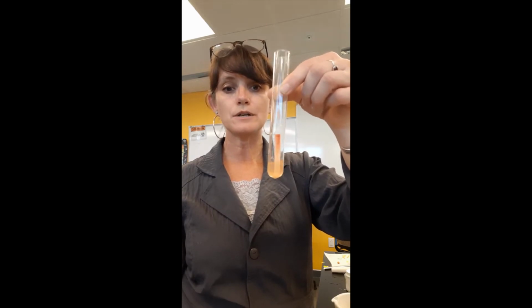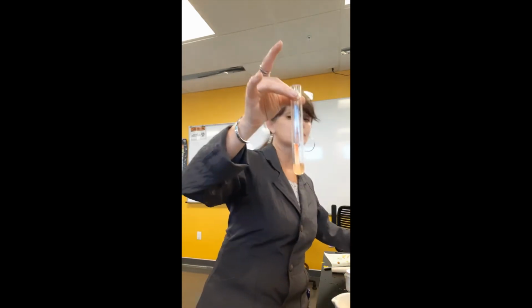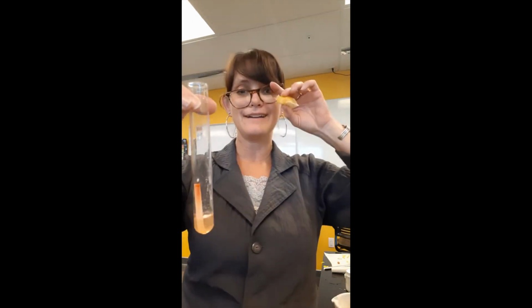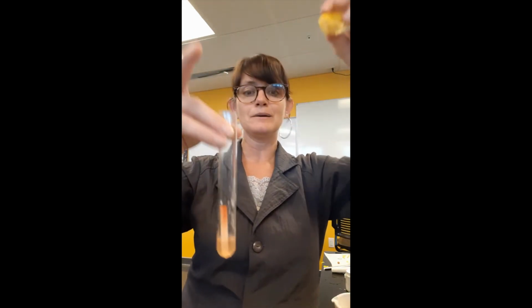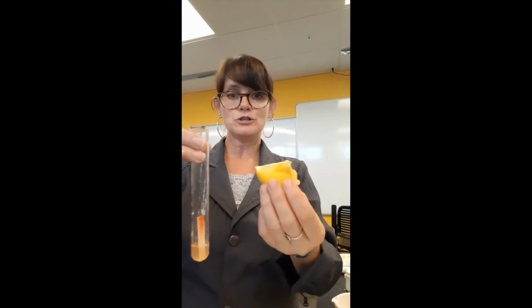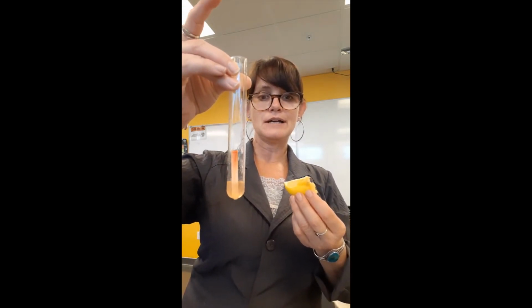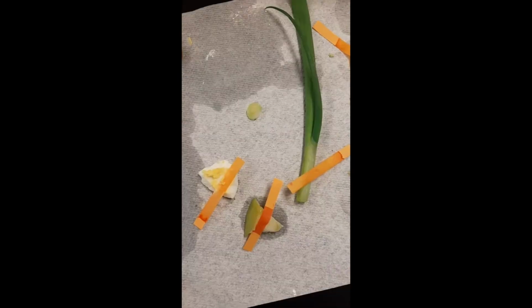This shows us with a known acidic solution, right? Our lemon, I have my protective glasses back on. Our lemon juice is highly acidic, contains sugars, no proteins, and so we do not get a color change. We'll also control for the pH of our food samples, so all of these variables are either slightly acidic or neutral.